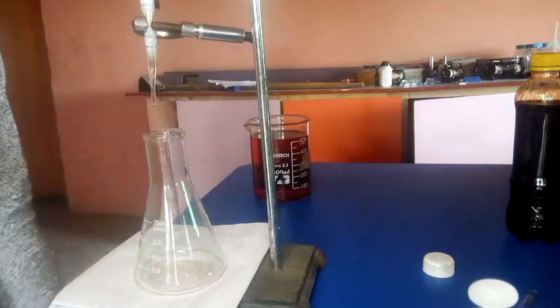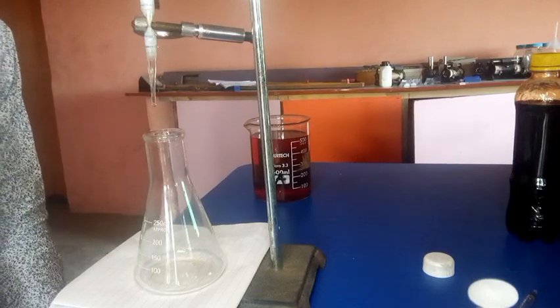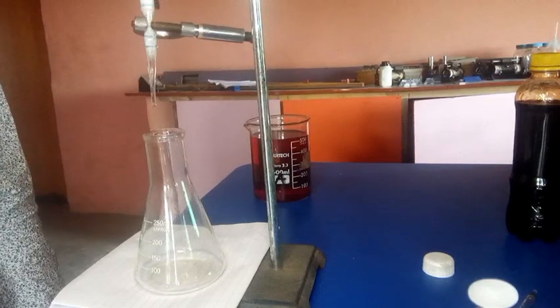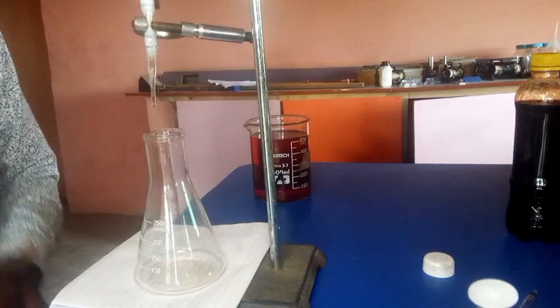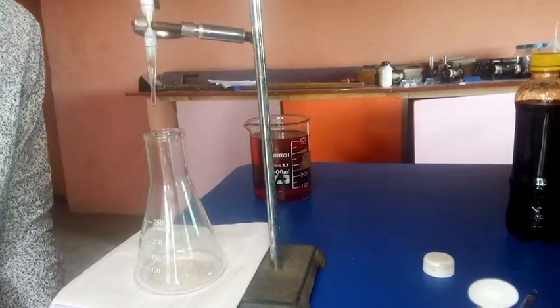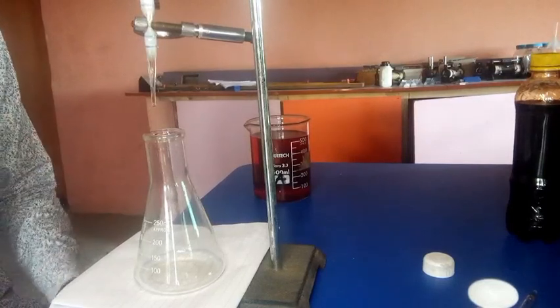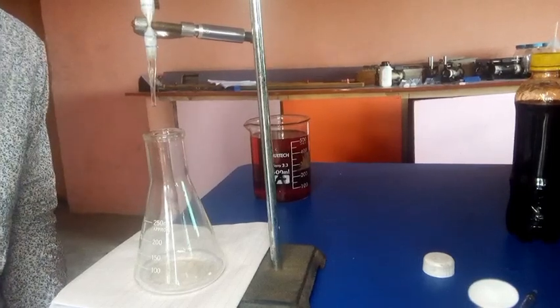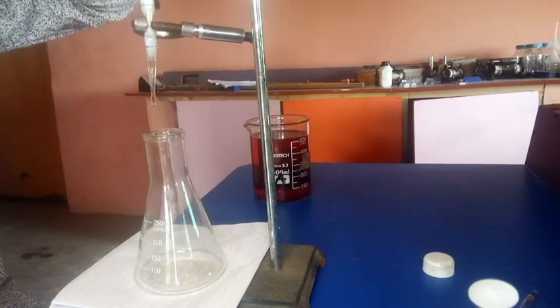And when filling the burette, ensure that the lower meniscus of the liquid in the burette touches the zero line, which means you try to avoid error due to parallax. After filling the burette, endeavor to remove your funnel so that it won't top up the solution in the burette, even when it's meant to be reducing at the point of titration. Those are the procedures you need to follow to obtain an accurate result. So now let us go over to the experiment.